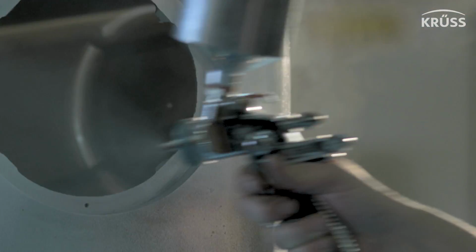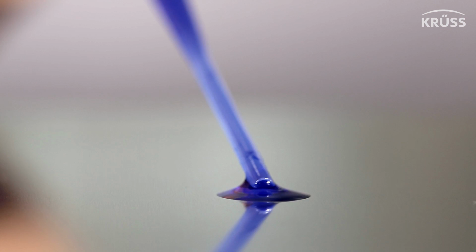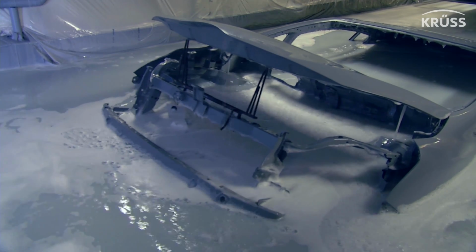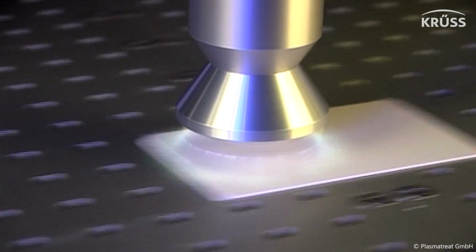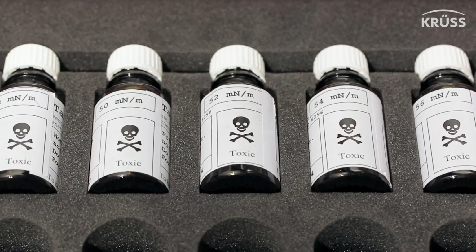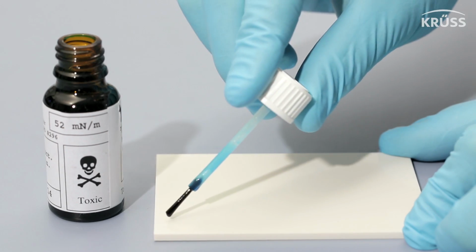For applying a painting or a coating, the surface needs to be hydrophilic. In that case, its surface-free energy matches the liquid. To achieve this, the surface often needs to be cleaned or even activated, for example by a plasma treatment. To test if the pretreatment was successful, test inks have been used widely in the past.